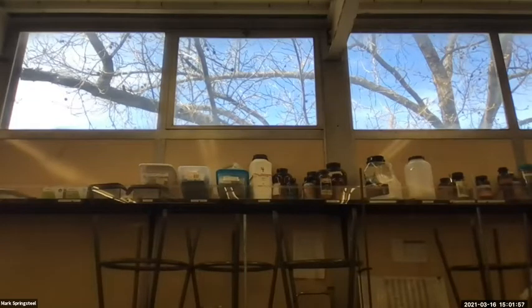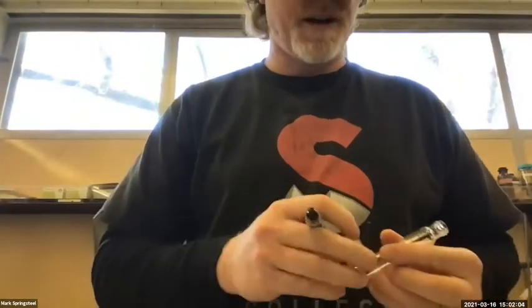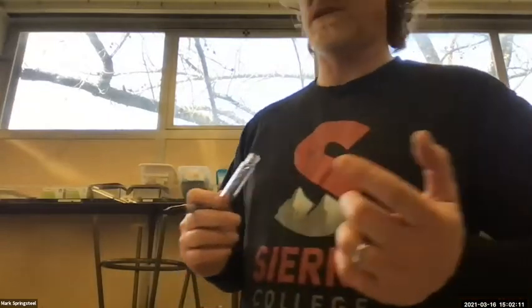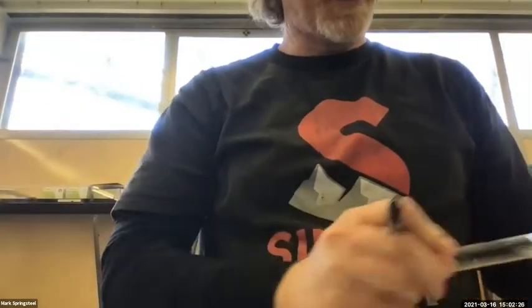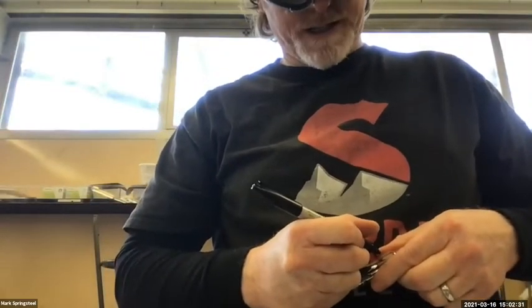The tap water won't contaminate it? No, well, if I was really worried about it, I could use DI water. But for most of what we're doing, tap water's fine, especially in the Sierra College area. Our water doesn't have that high salt content like you get at Davis. When I was at Davis, the tap water there was harder, has more ions. Or we will see when I'm done with my extraction. If it looks like our IRs look good, we figure out we did do the separation, then we're going to say tap water is good.